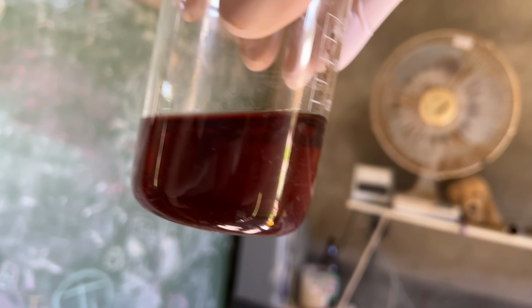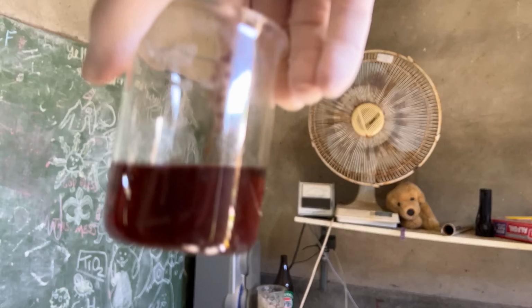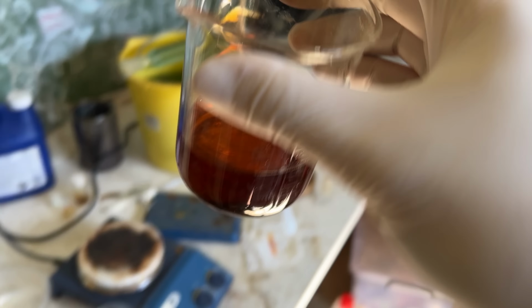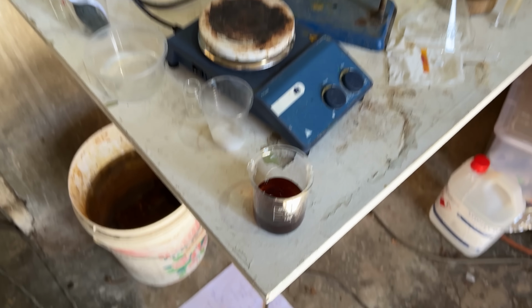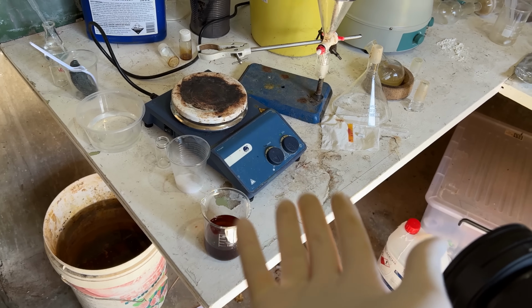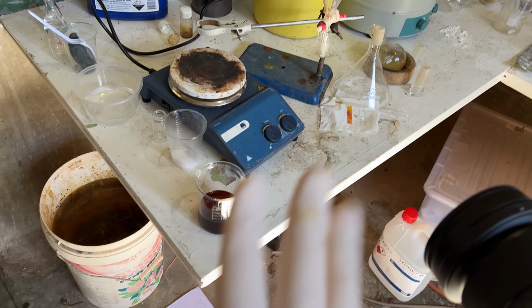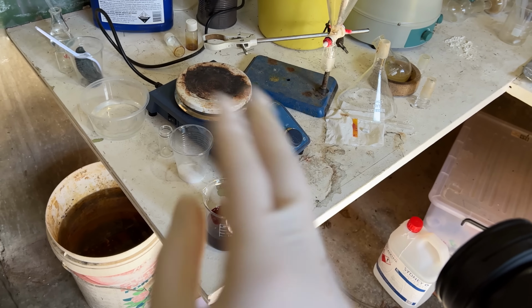Here's all our combined extracts. It's very dark, and it looks like some insoluble stuff in there too. Well, I guess low solubility stuff. There's some of it on the side, and some water down the bottom. It's mostly water down there with a little bit of the precipitate. So I'll dry it out over some calcium chloride and then run it through a filter, and it'll get rid of all the polymerized crap as well as the calcium chloride, and then we can evaporate off the ethyl acetate to leave us just with our nice residue of cubane, which will probably look exactly like this.